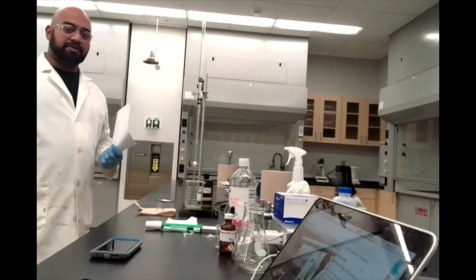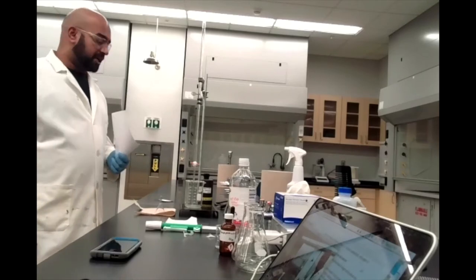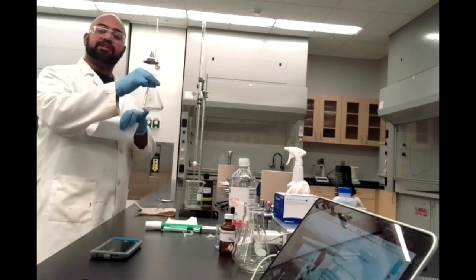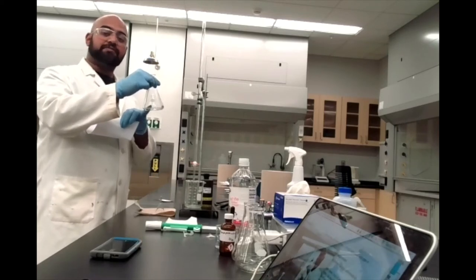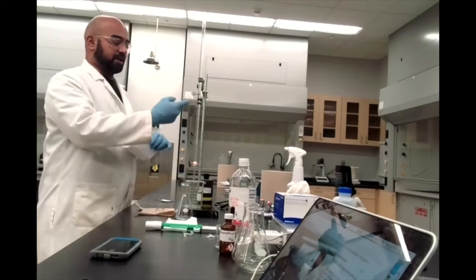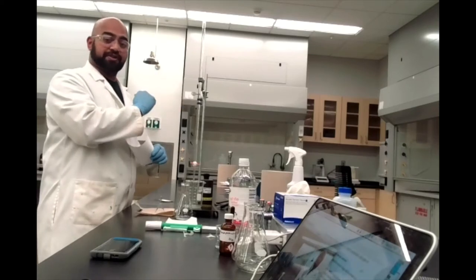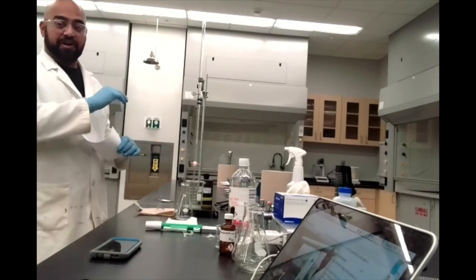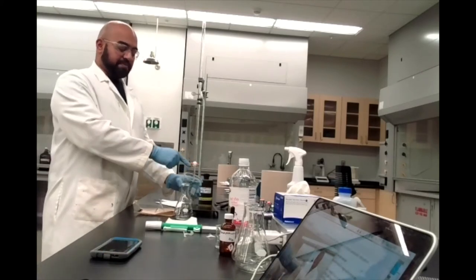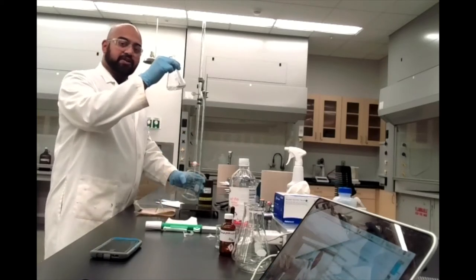Now we're getting ready to start our first trial for titration. I have my Erlenmeyer flask with five milliliters of vinegar and a couple of drops of phenolphthalein. In my burette I have sodium hydroxide and I know its concentration — that's going to be very important for calculations later on. I want to swap out the waste beaker and add my Erlenmeyer flask underneath the burette.